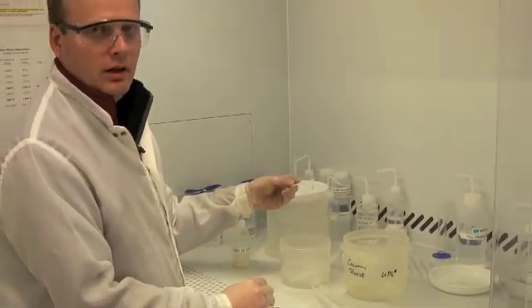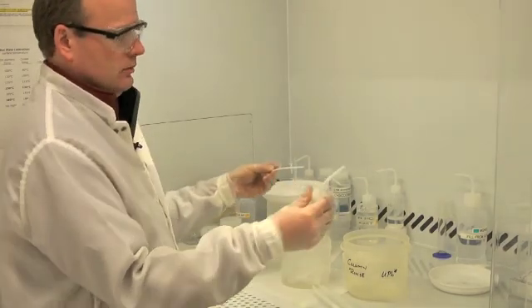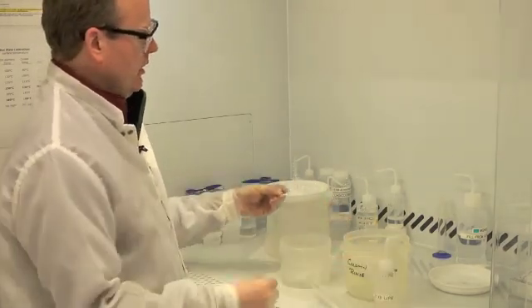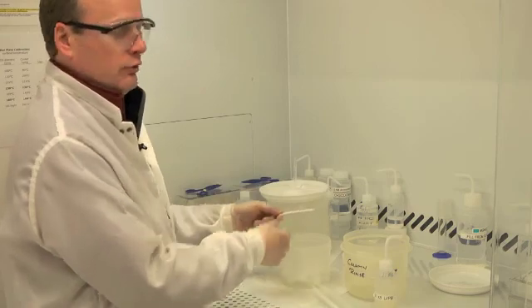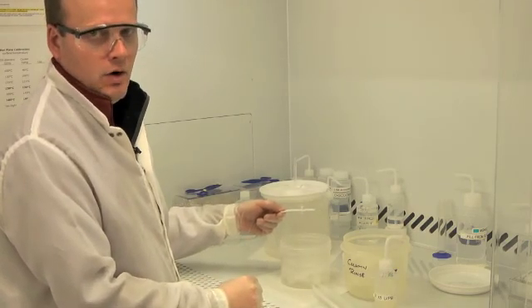I'm going to start by washing these columns in clean water. Then I'm going to slurry the resin in from this dropper bottle, place it on the stand for further cleaning before doing the chemistry tomorrow.